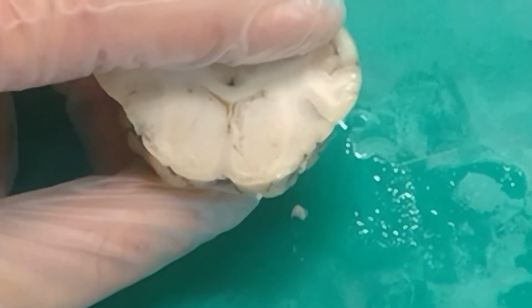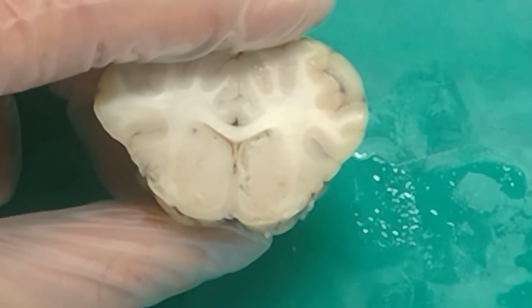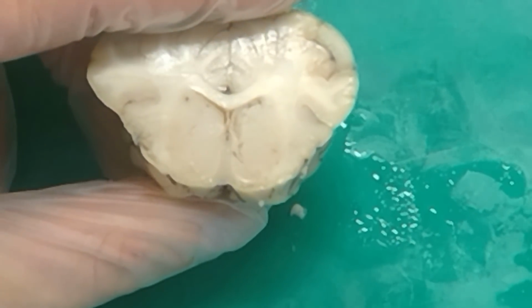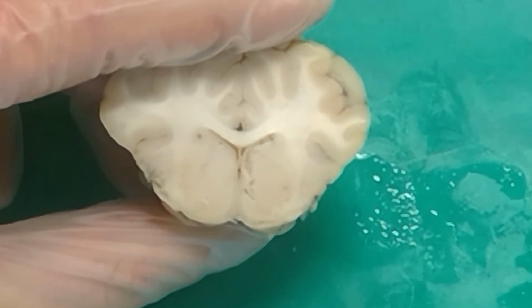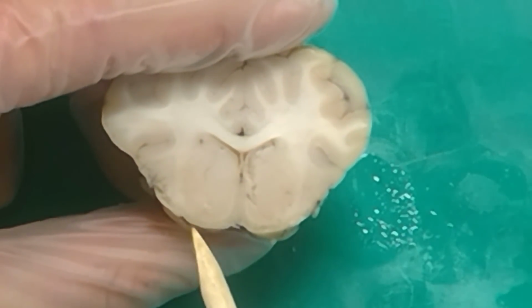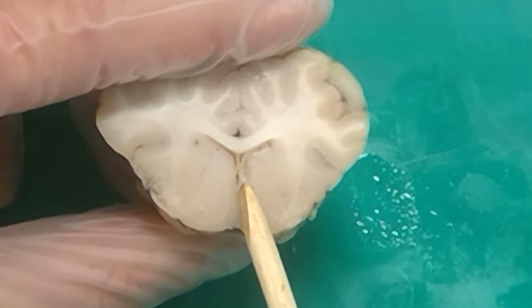Question? There's nothing I can really ask about that. How thick is it up here versus down there? There's not really a question about that. Yes? How would we know that the septum is connecting to the perforated substance? You can see it right here. I'm not going to ask you what is this continuous with, probably. But you can see it right here that this is continuous with it.